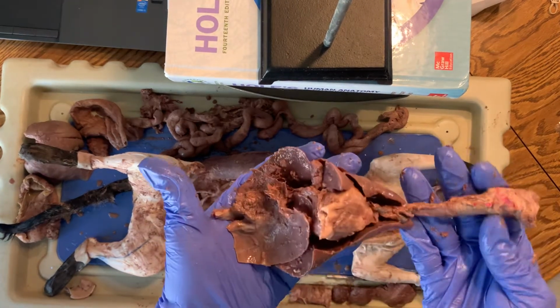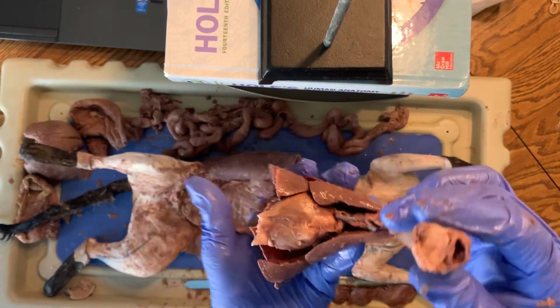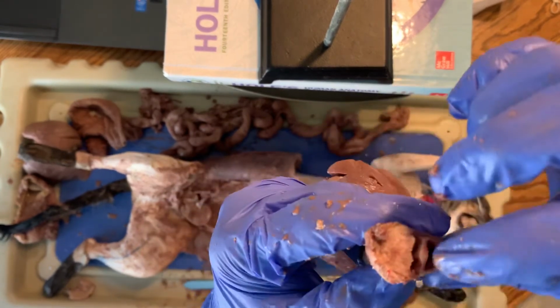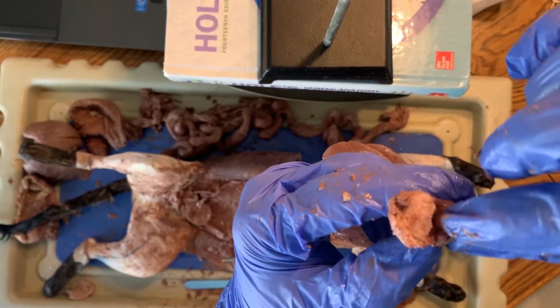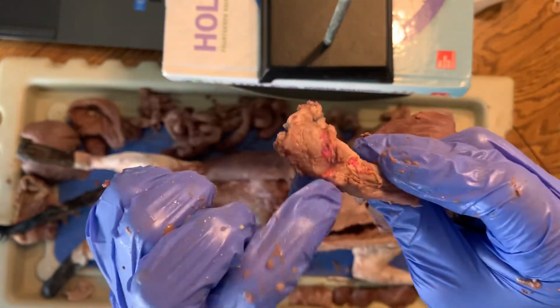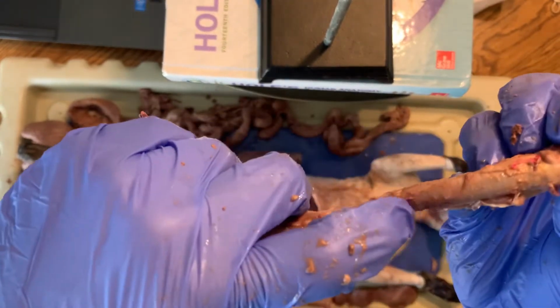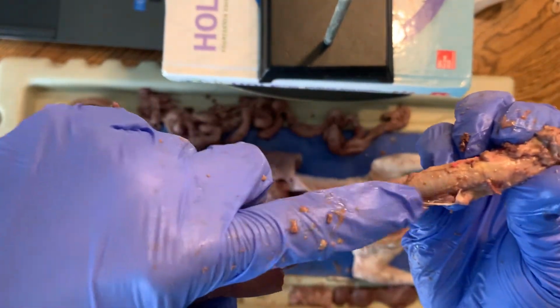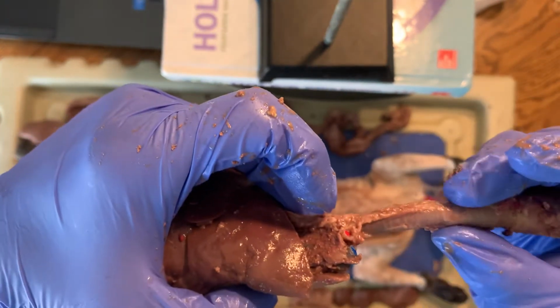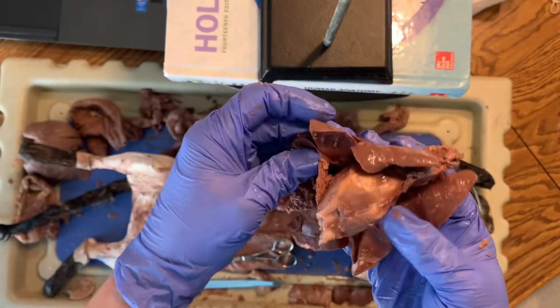So this is collectively called a pluck because I can literally pull it and pluck it all the way out. So again, if you didn't have a very clear view of these, this first opening right there is the trachea, which is going to lead to the lungs. The back one there is the esophagus. The esophagus is the soft squishy tube. The trachea is really hard because it has all this cartilage right there in all of the rings. So it looks like lines going through it. But that's good because that's helping to keep your airway open. That then leads down to your lungs.